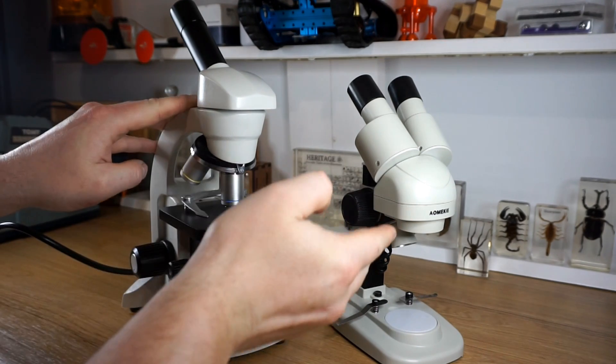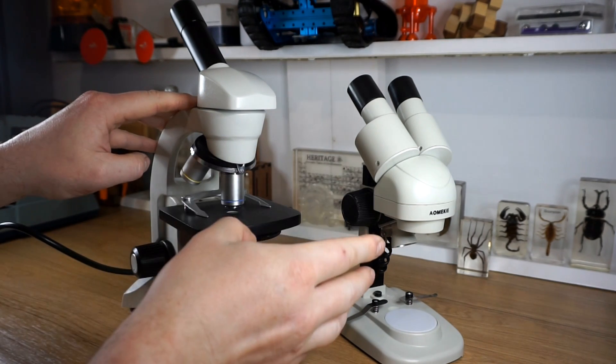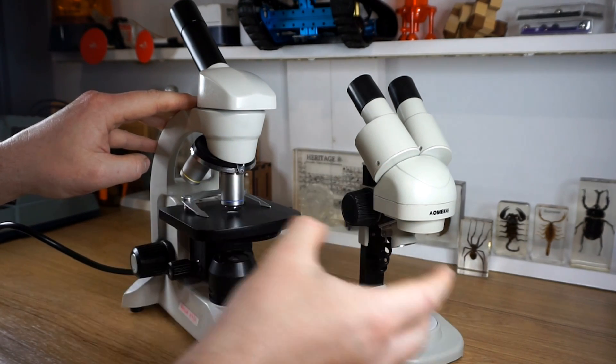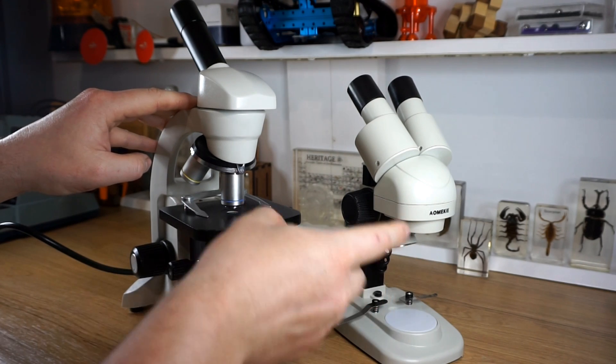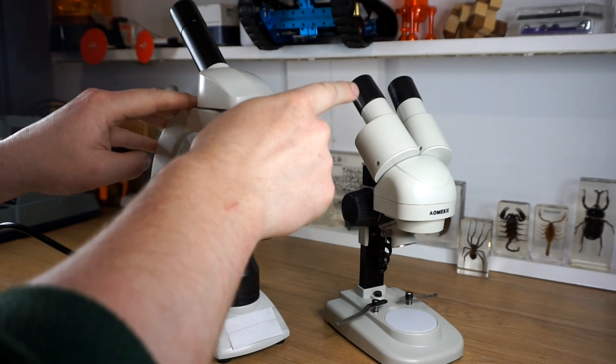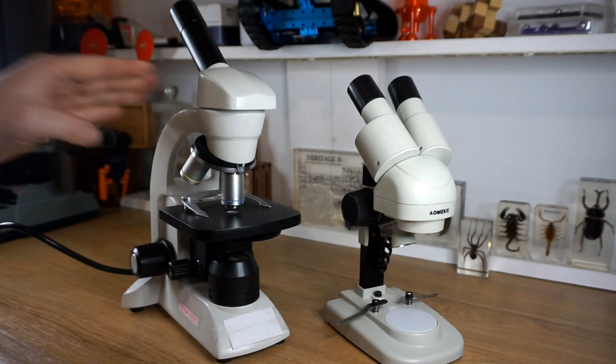Stereomicroscopes don't often allow you to change the level of magnification. It's often just the 10x that's built into the ocular lens in the eyepiece.